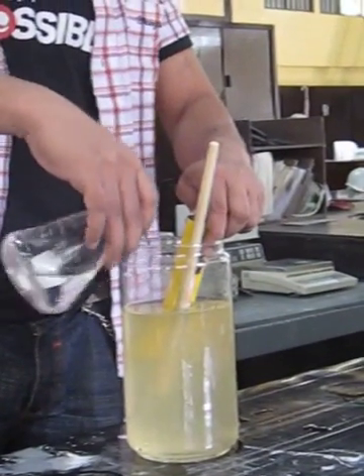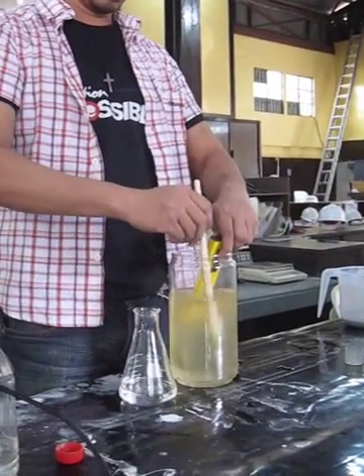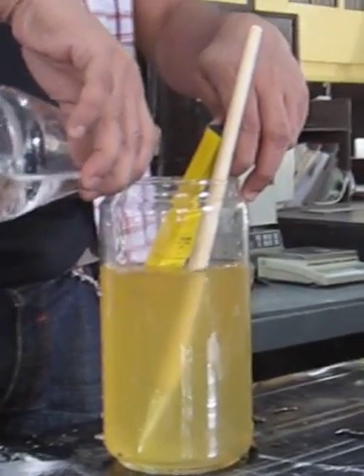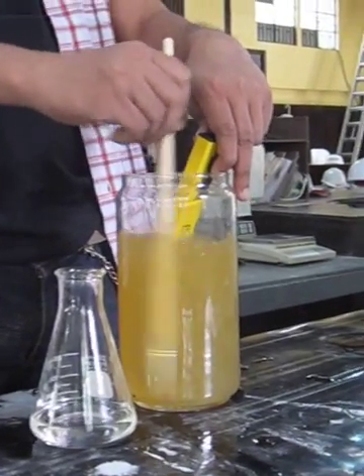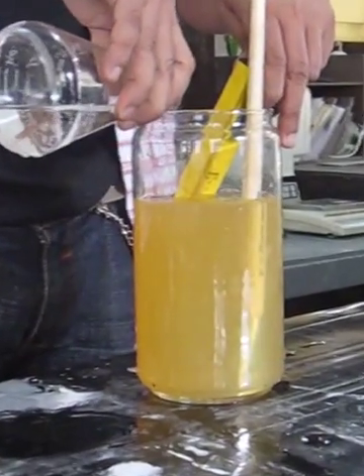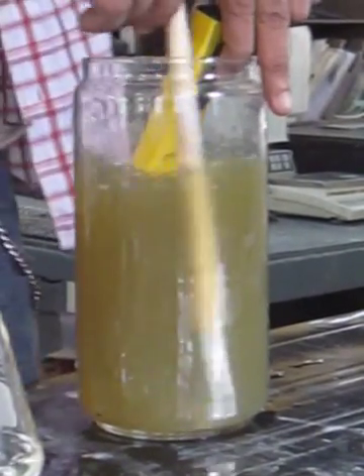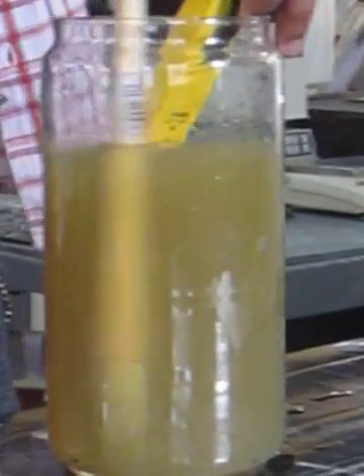So we're going to add caustic soda — this is 20%. As you will see, caustic soda changes the color of the solution. Actually, it oxidizes the copper.